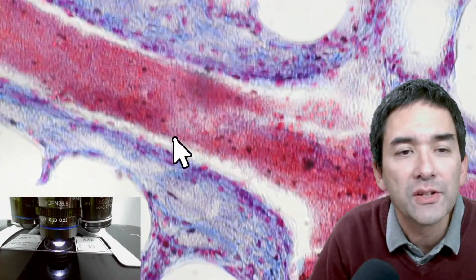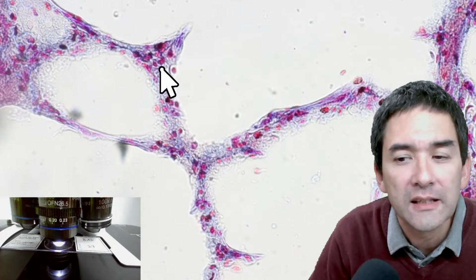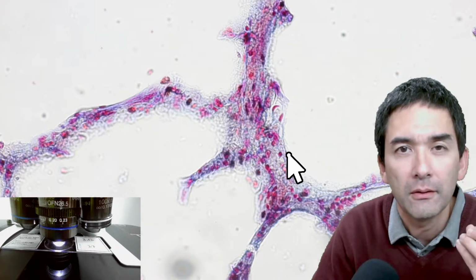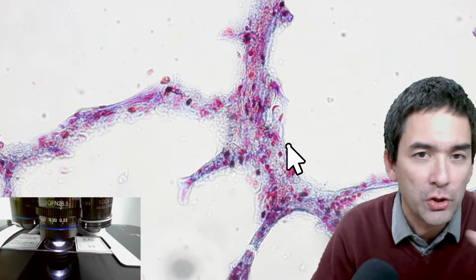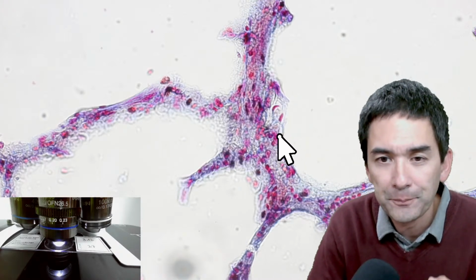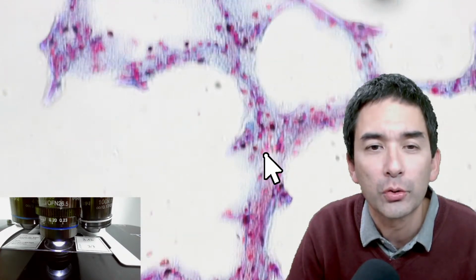So very nice to see. The thing is with those histological slides, we see only a two-dimensional cross section. In reality, the alveoli, those air sacs, are sometimes compared to grapes. Of course they're not two-dimensional, but three-dimensional, like little bubbles, like little grapes. Basically because they're cut, we only see a two-dimensional cross section here.